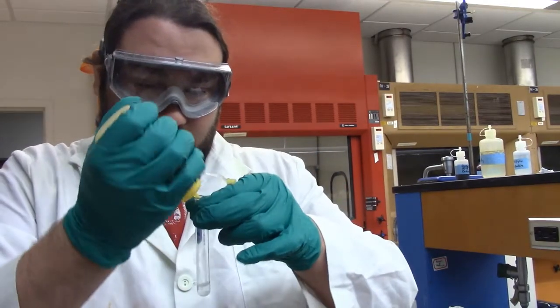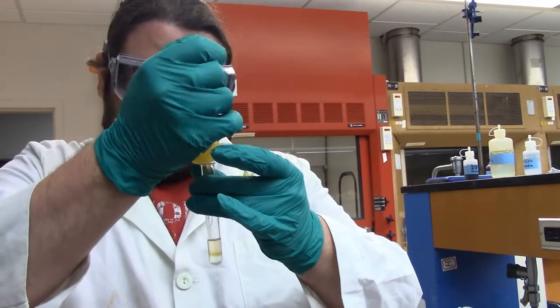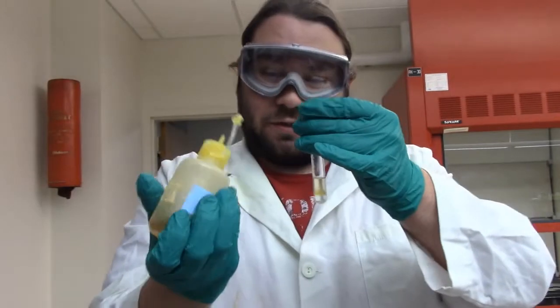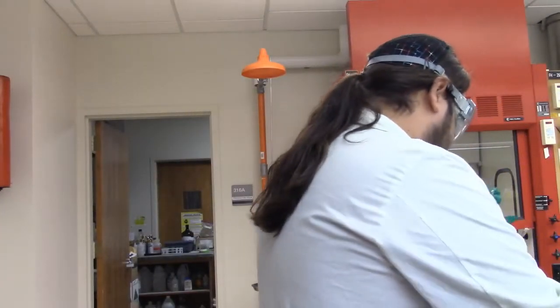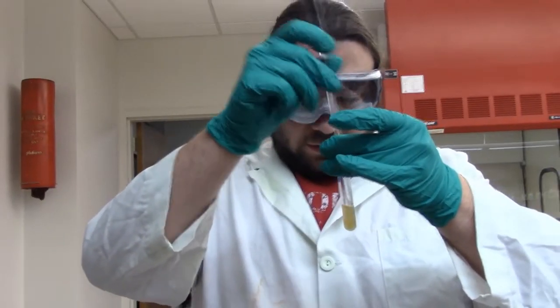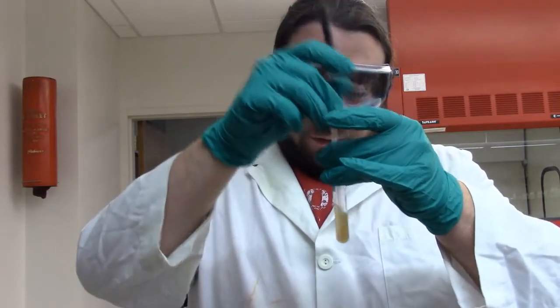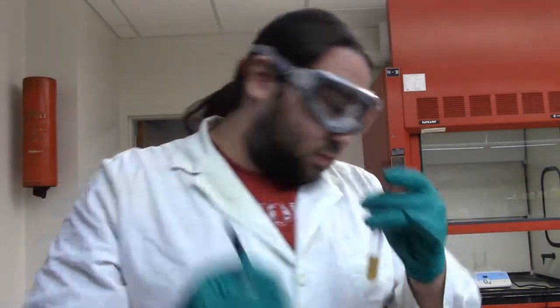Or not. Alright, I'll call that 20 drops, I guess. I don't know if you saw that, but that just all kind of poured out, so. Give it a good mix. Kind of left with, I don't know what you want to call that, tan brown solution.